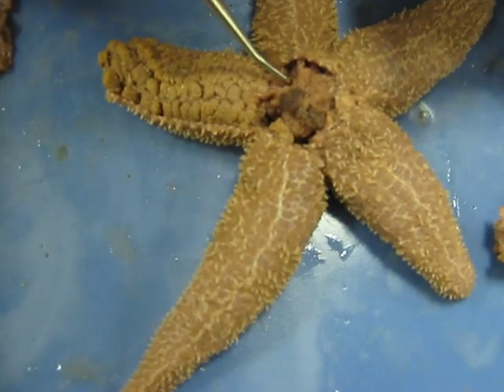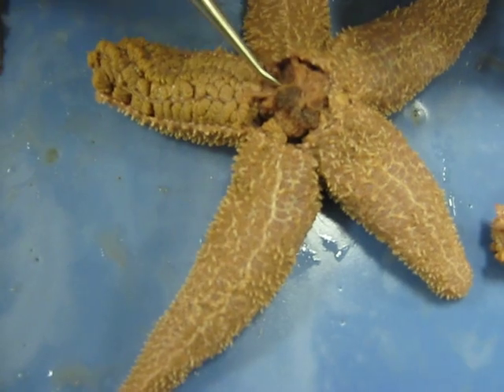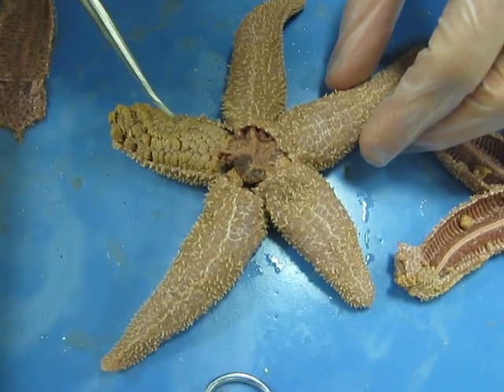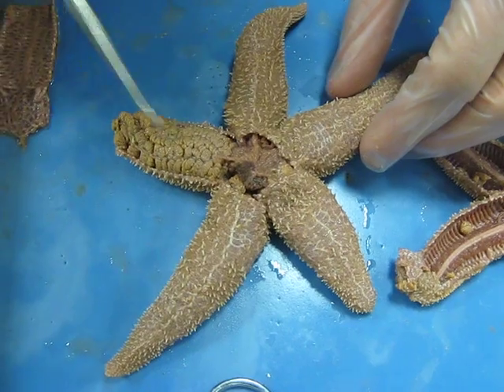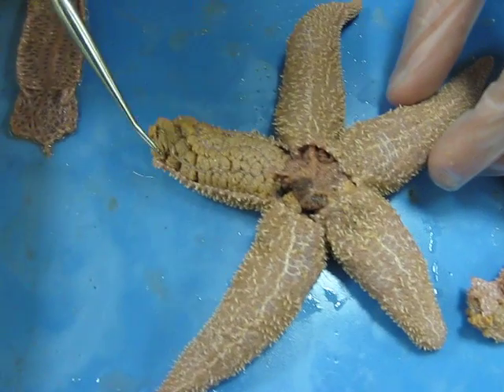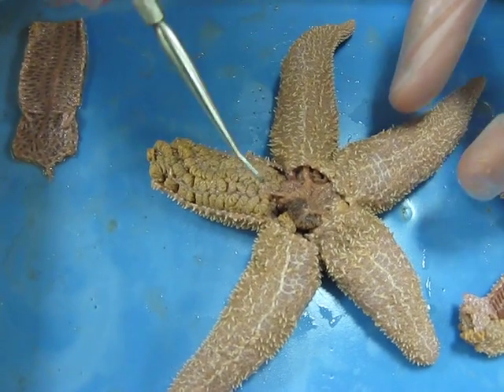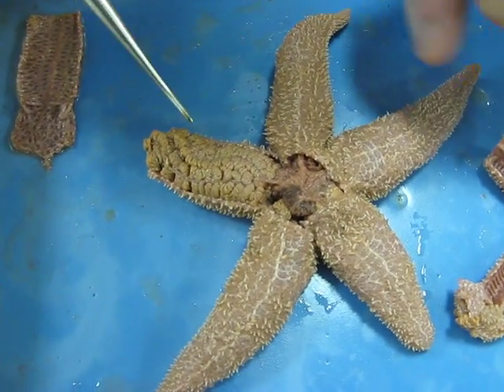In the pyloric chamber there are five pyloric ducts right here. You can see there are small ducts that lead into the pyloric ceca, which is this whole mass right here — the cecum. It's the digestive system here.